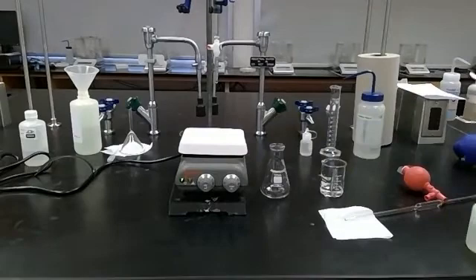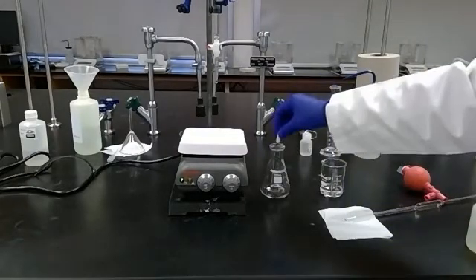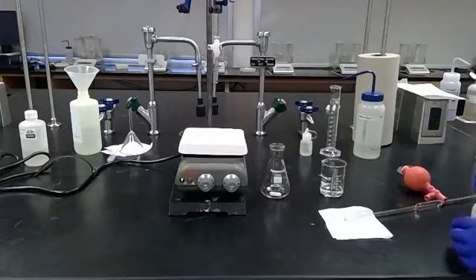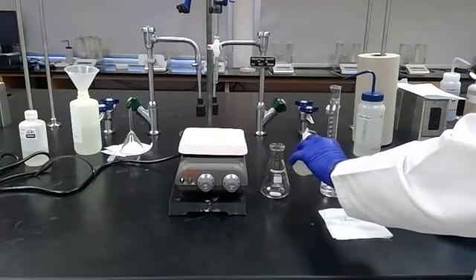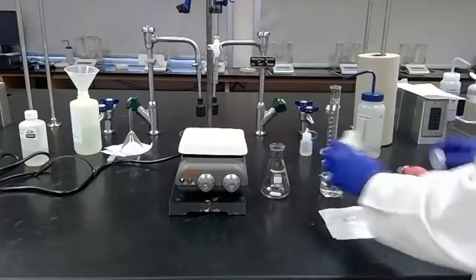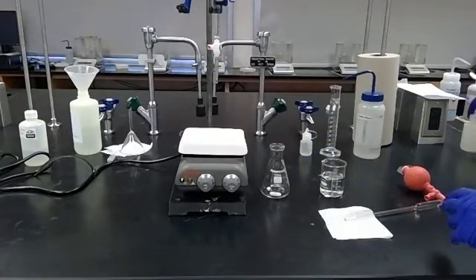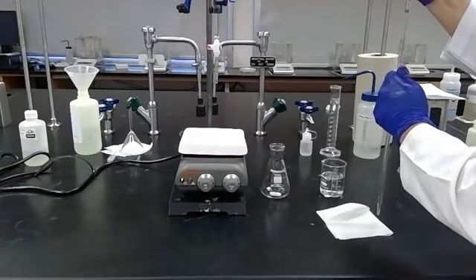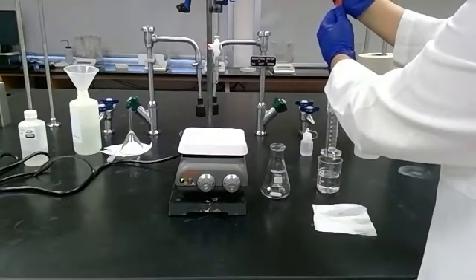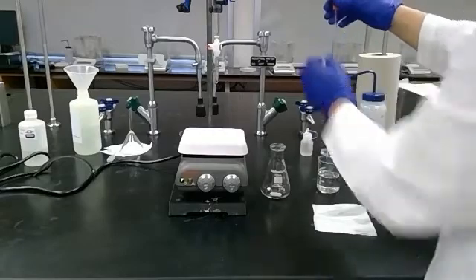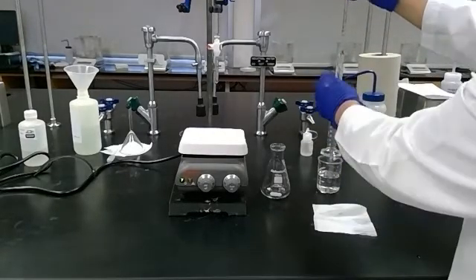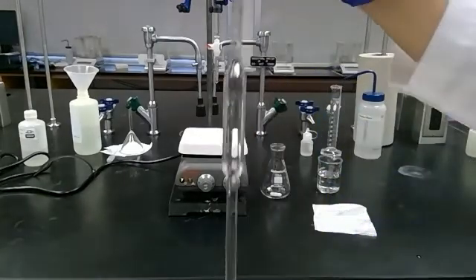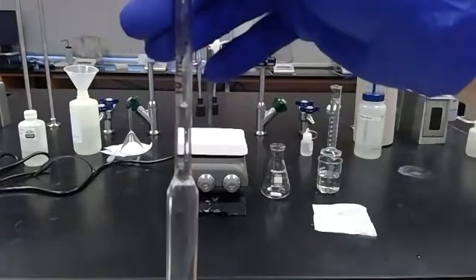I'm going to use a 125 milliliter flask and a stir bar and stir plate this time, so I'm putting in a little magnetic stir bar. I'm going to get a little bit more of my unknown acid number two. Now my plan is to pipette 10 milliliters of my unknown acid.